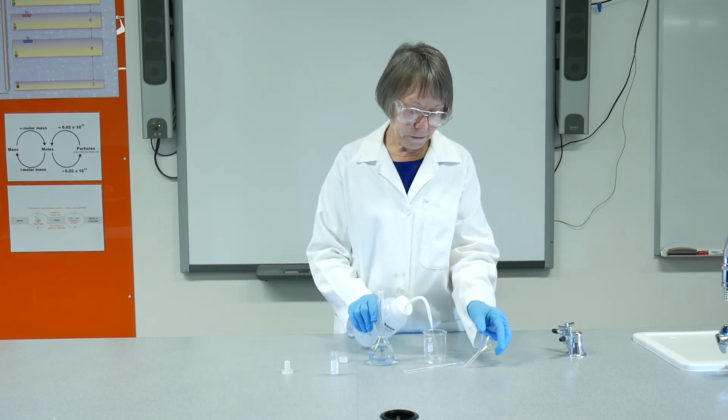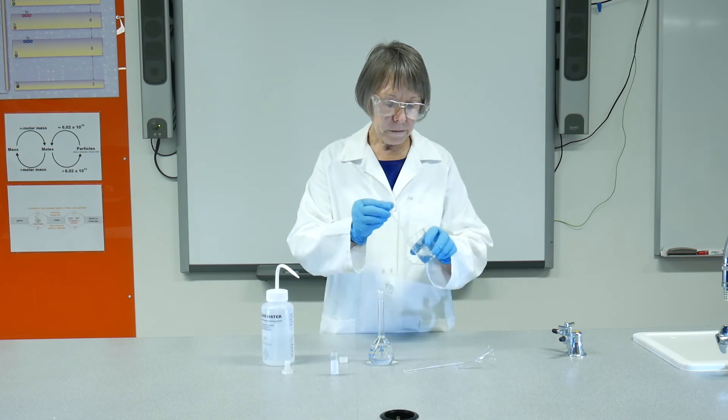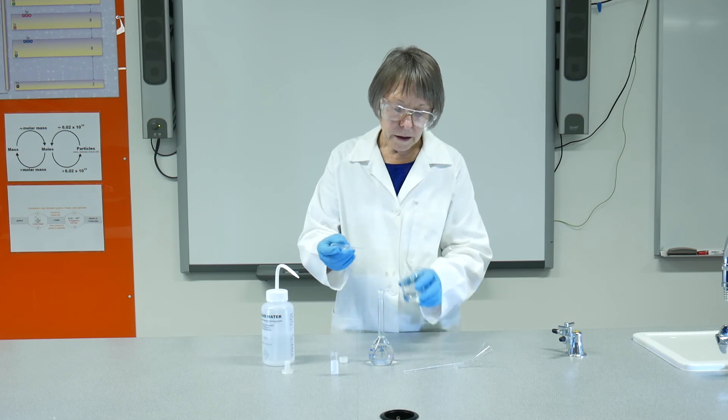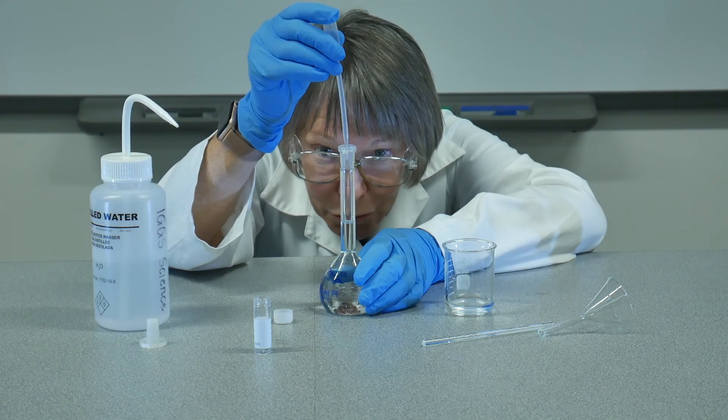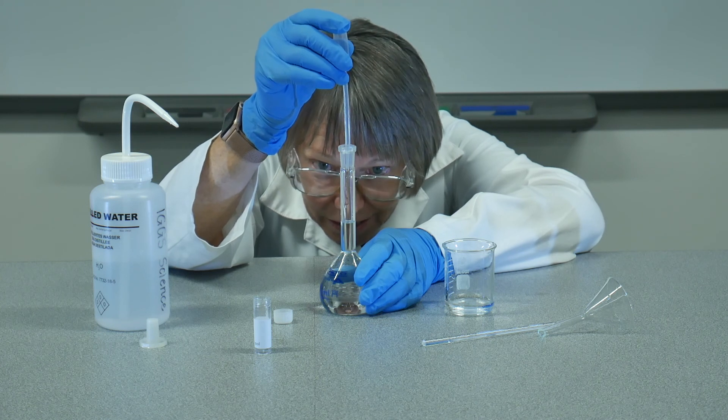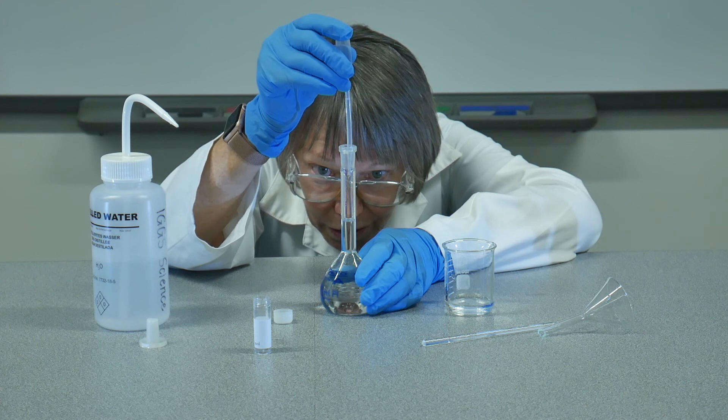So I'm going to put some water into the beaker again. Just using the dropper now to make sure we get that meniscus to the line.